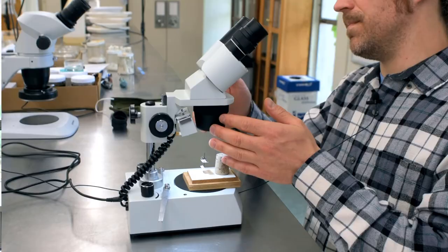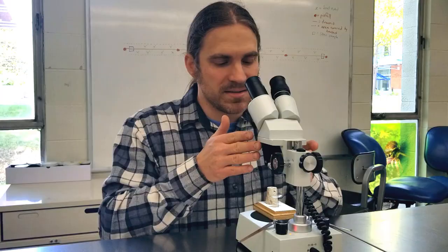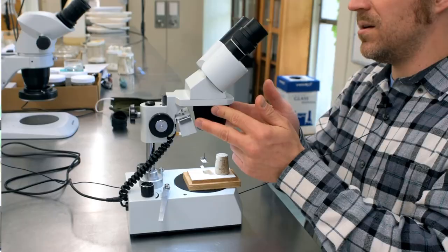If you look through a microscope and don't see any light, there could be a different type of problem. On this microscope, the zoom has two different sets of lenses, and if it's caught between those lenses, there's just nothing there because the lenses aren't lined up with the eyepieces — you have to turn it until it clicks in place. Another reason may be a lens cap on the eyepieces or on the bottom lens. Many stereo microscopes have a built-in light source; this one has a light up top that can't be adjusted.